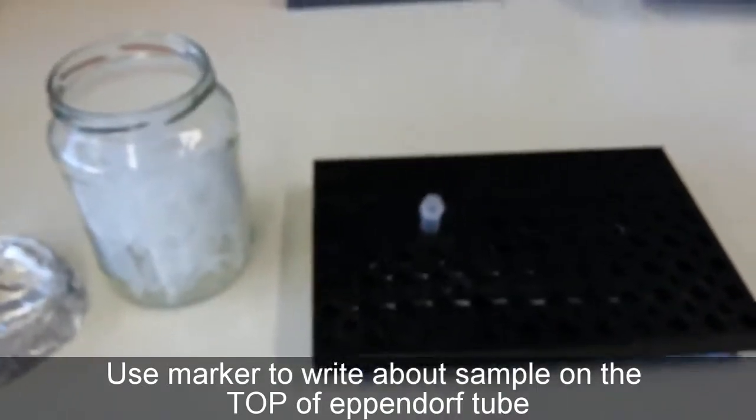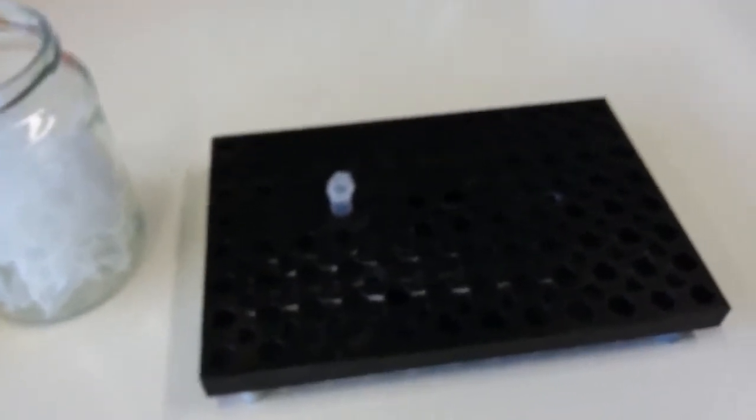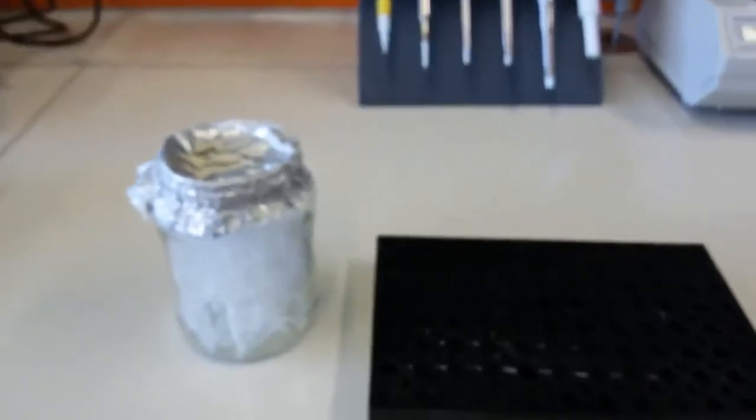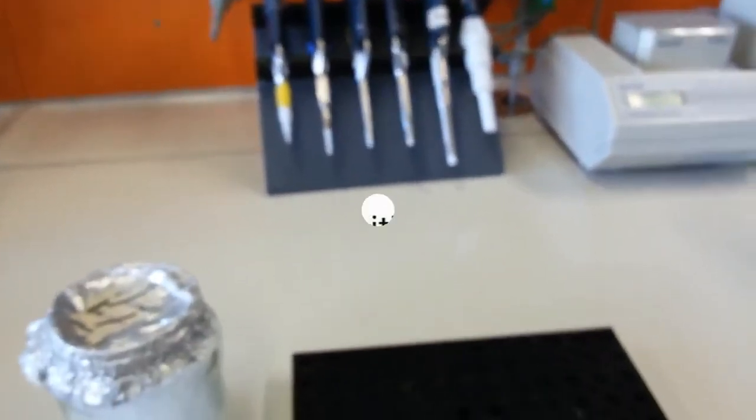This is the most important lab utility. We always use the Eppendorf and Eppendorf stand. We do most of the reactions and most of the tests in Eppendorfs, so you should know that one. Great. So far these are the common lab utilities which I think you should know. In front of them you see some more stuff, and we will talk about them in a while.